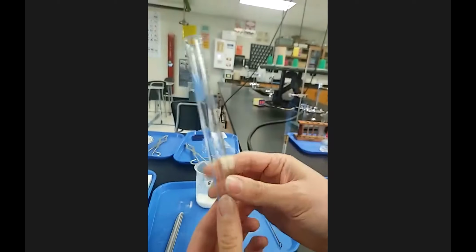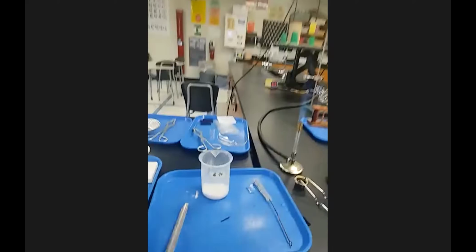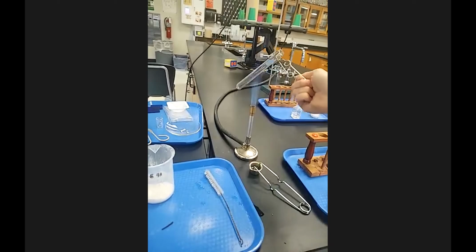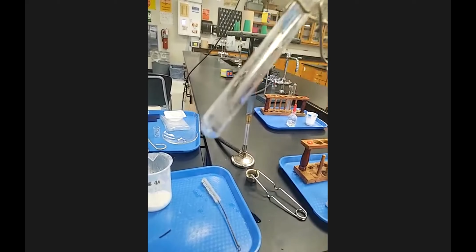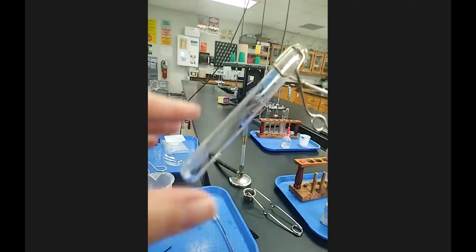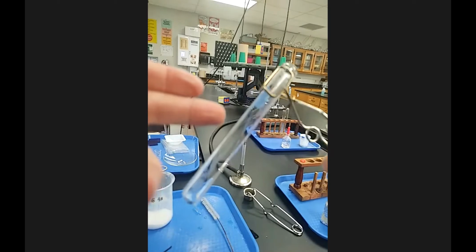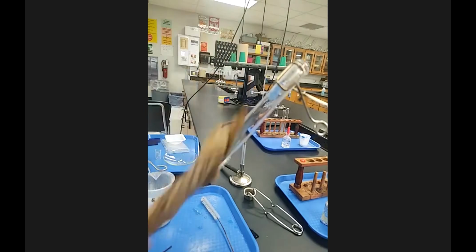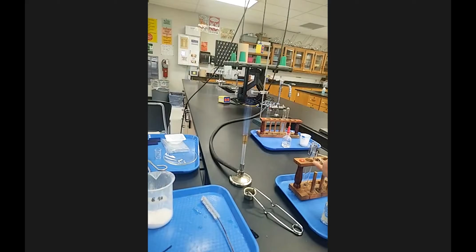So another way to quickly dry a test tube, if you've already rinsed it and everything, is to just heat it for a little bit and drive off the remaining water. You can already see it's fogging up, but that's another way to drive off the water. Or get a second paper towel if you're not supposed to be using the Bunsen burner to dry glassware, because then it's hot again, it's very hot. You've got this one which is wet, roll up a second one and get it dry there. So just a couple lab techniques for you.